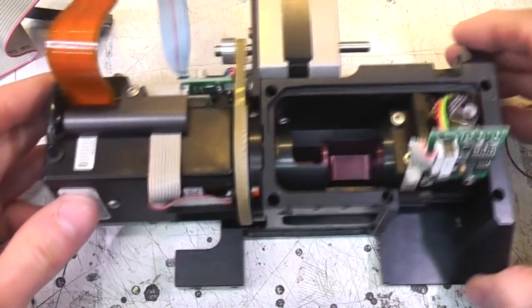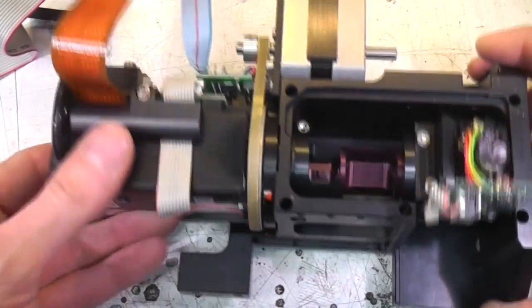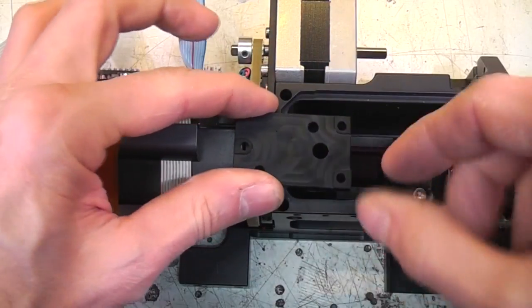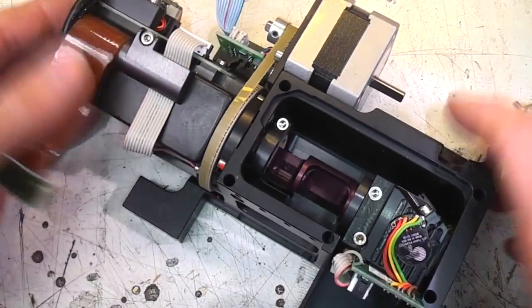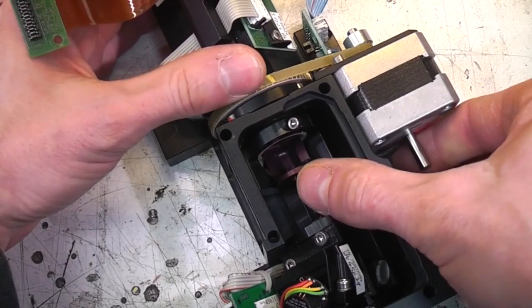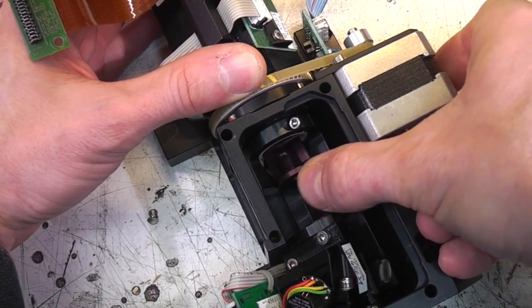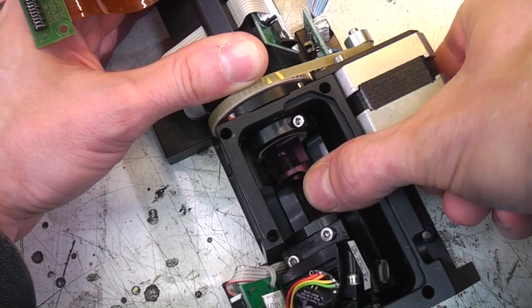Okay, this makes a little bit more sense. So I was a little bit puzzled about what's happening with this galvanometer here, because the mirror that takes the beam path into this section sort of seemed to just disappear, sort of go into here. I can't figure out, well, how can that be doing anything? What's actually happening is we've got this whole rotating thing, but then the galvanometer can then rotate this part and sort of scan in this direction. So we've got sort of an overall rotation, and then the actual scan part of it.